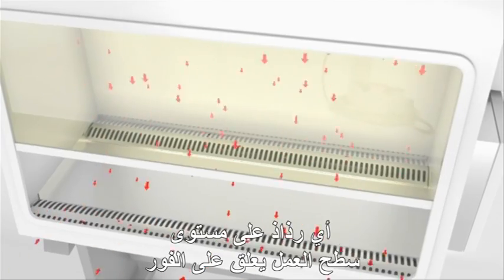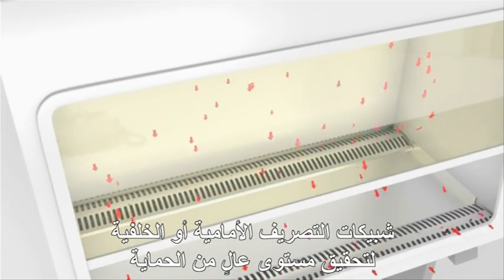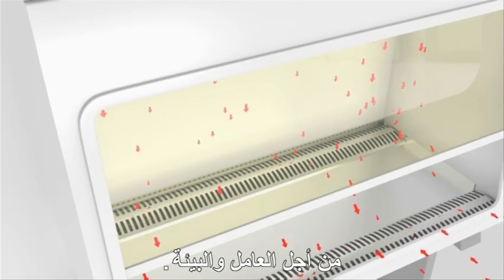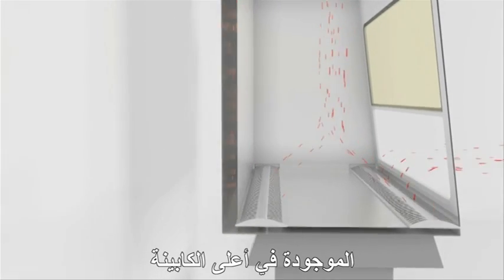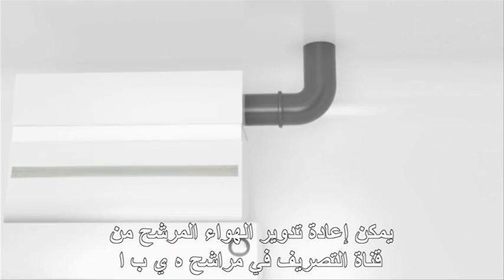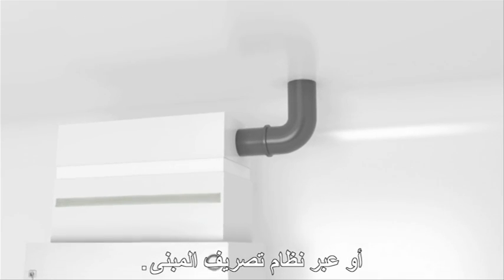Any aerosol particles at the work surface are immediately captured in this downward airflow and pass through the front or rear exhaust grilles, achieving a very high level of protection for the operator and the environment. The air is then discharged through the rear plenum into the space between the supply and exhaust filters located at the top of the cabinet. HEPA filtered air from the exhaust can be recirculated to the room or discharged to the outside of the building through a dedicated duct or through the building exhaust system.